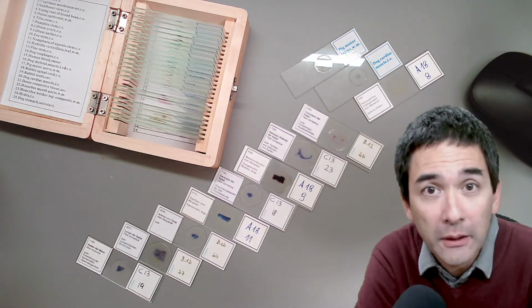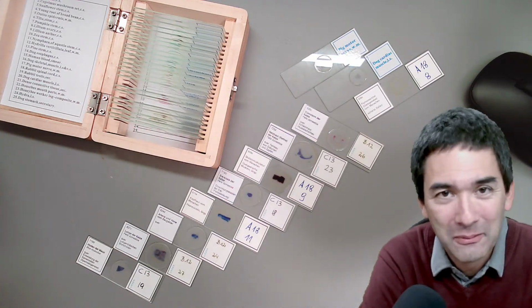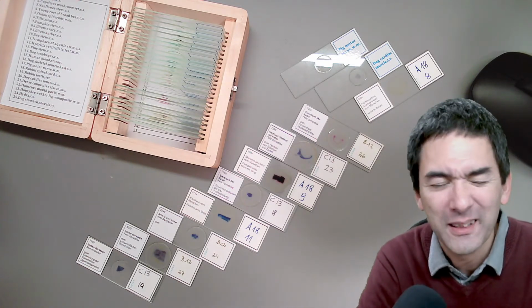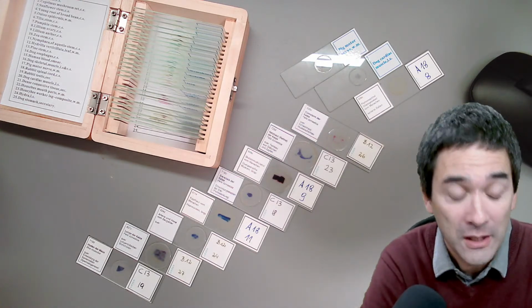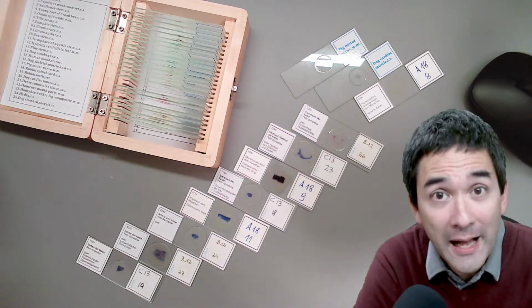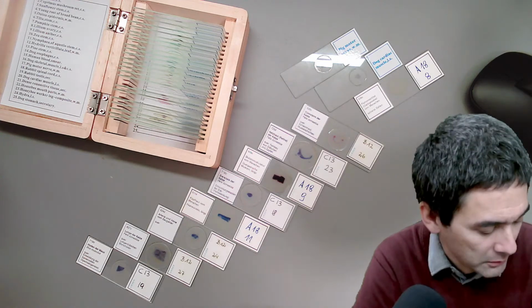Primarily I would like to look at mammalian tissue, so tissue from mammals. Up to about 1 hour ago I used to call the episode Body Parts Under the Microscope, and then I realized this sounds a little bit strange, so I changed it to Tissues Under the Microscope. Some of the tissues here are from humans and others are from other animals, but it doesn't matter because it looks exactly the same among all mammals.